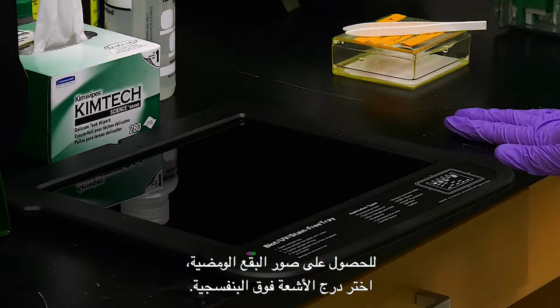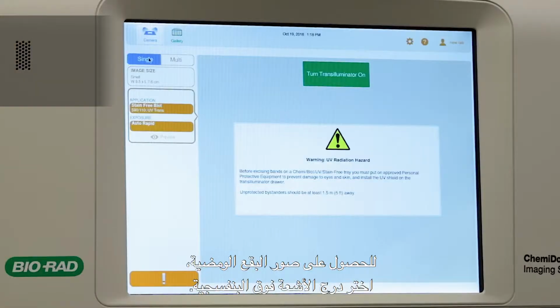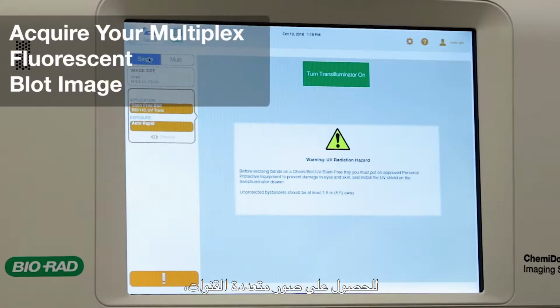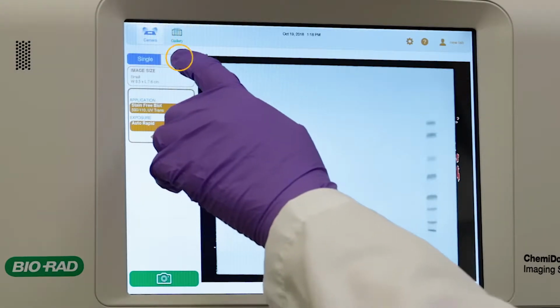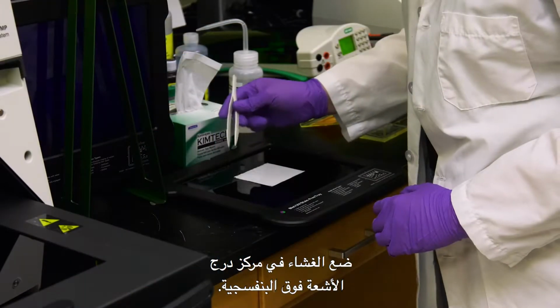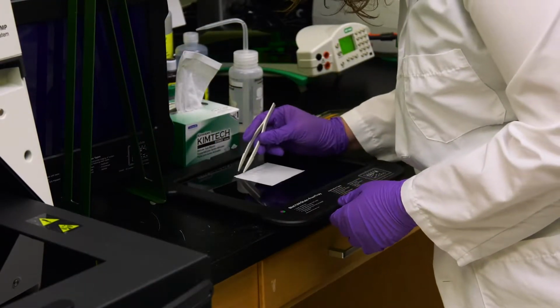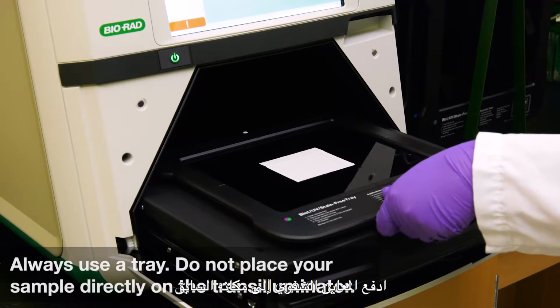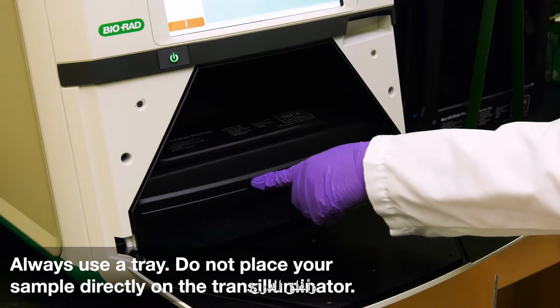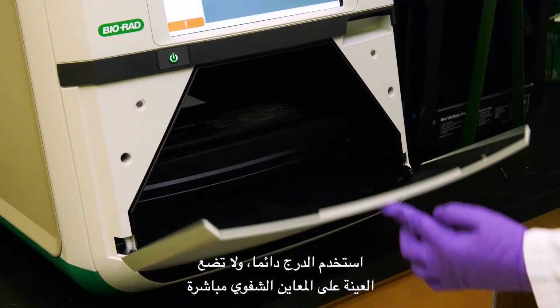For fluorescent blots, select the UV tray. To acquire multi-channel images, begin by tapping Multi. Center your membrane on the UV tray. Once you are satisfied with the position, push the transilluminator back in and close the drawer.